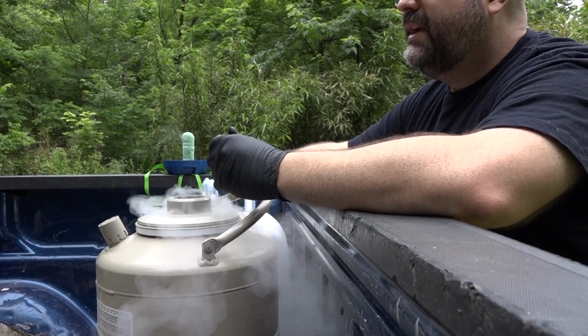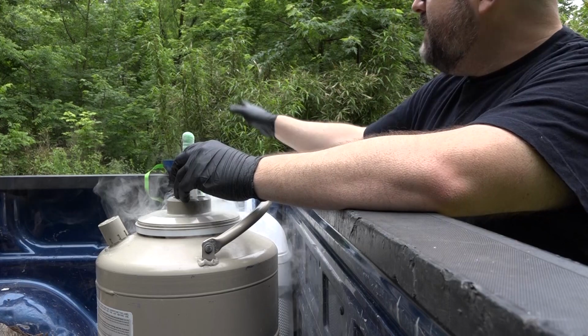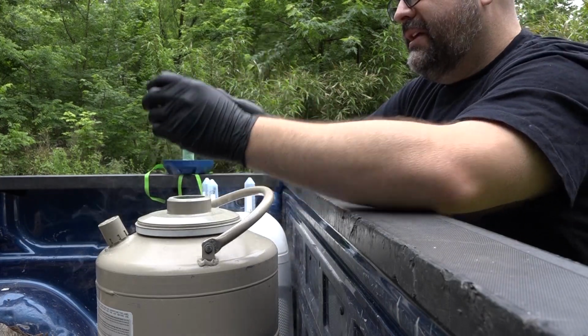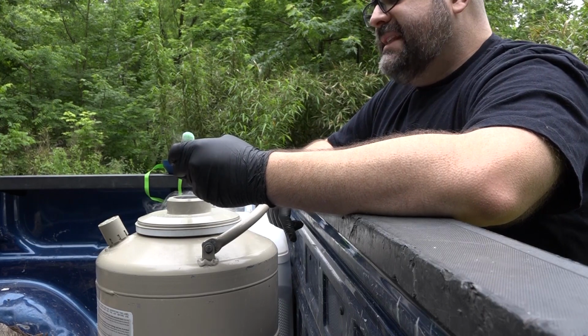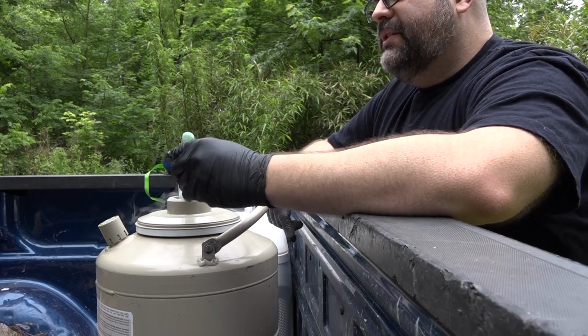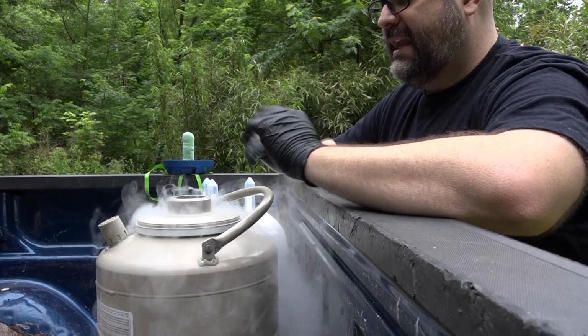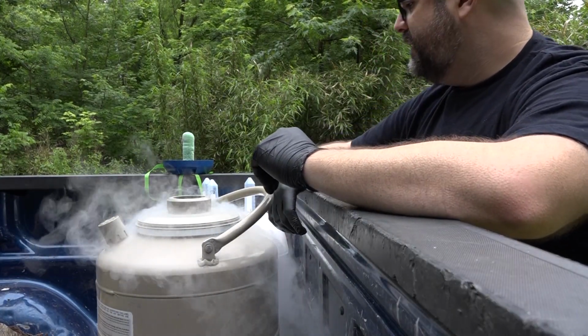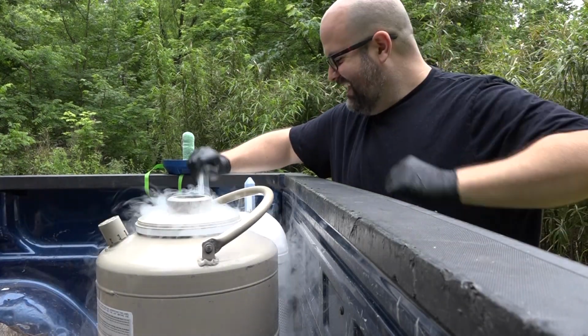We have a plan in case it evaporates out, because keeping it closed helps a lot, but you can see it coming out now. We'll get some dry ice and leave the samples on dry ice. But this flash freezing takes care of everything. You want to do some dropping? No, go ahead. Are you sure? Yeah. I'll make sure the camera doesn't fall out.